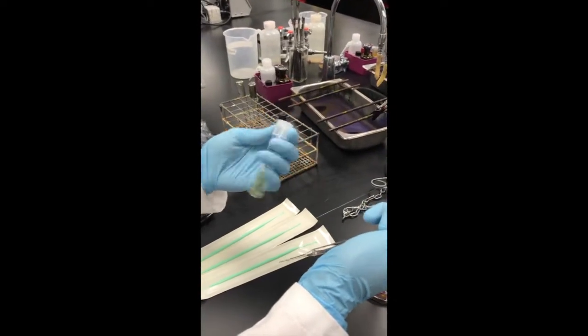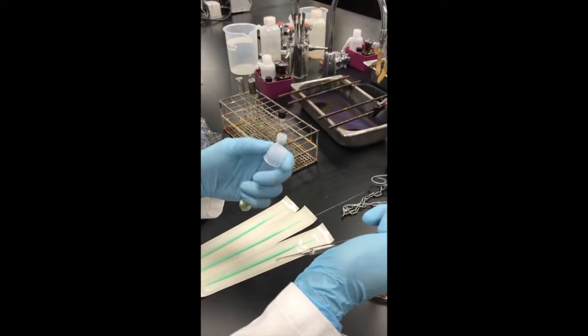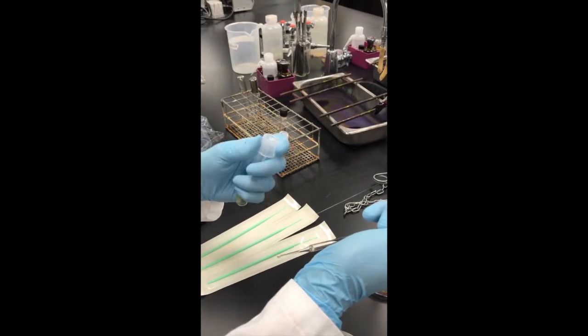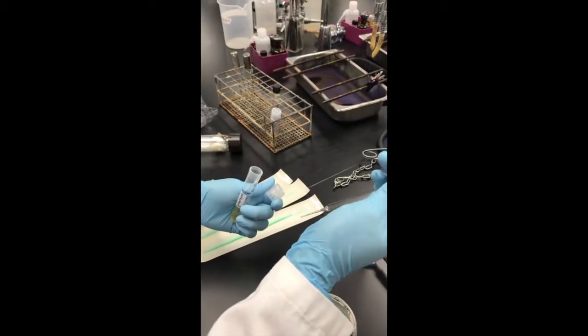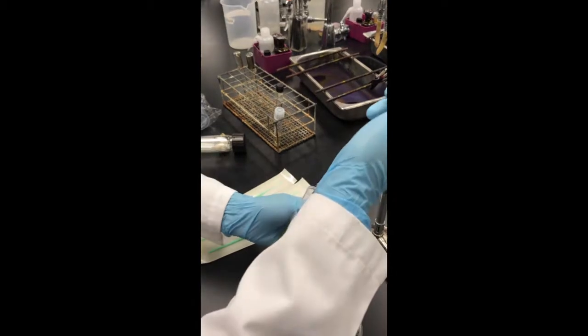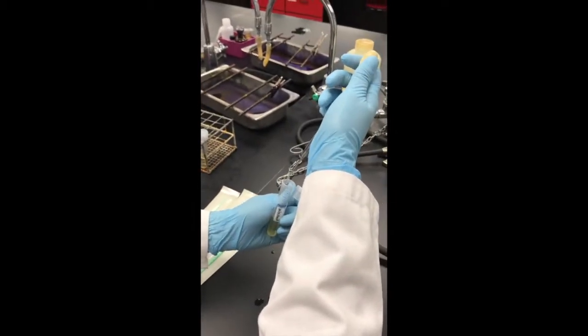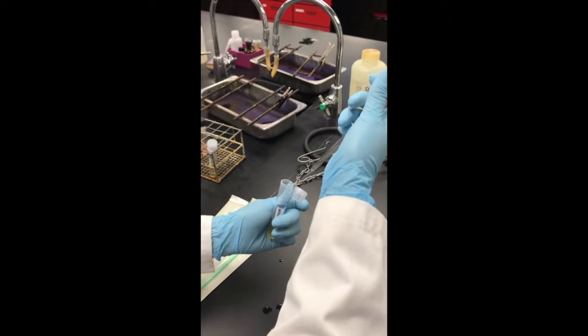So you have your infected tube. So with your infected tube, you're going to add one drop of the serratia, and that's it.